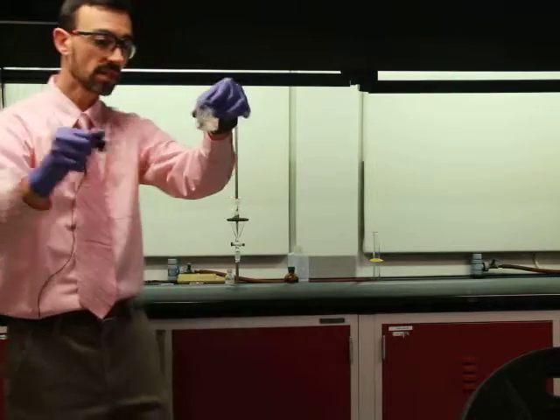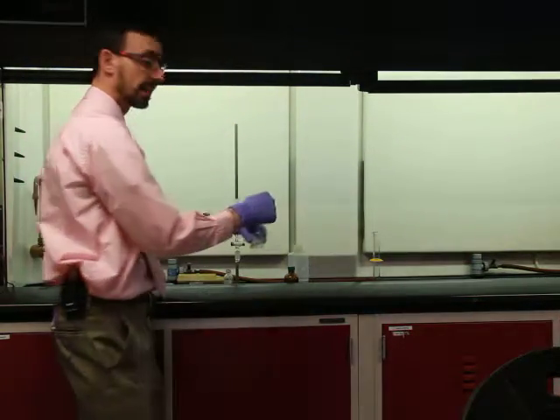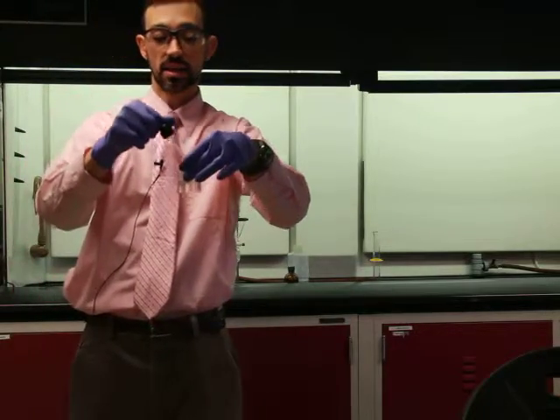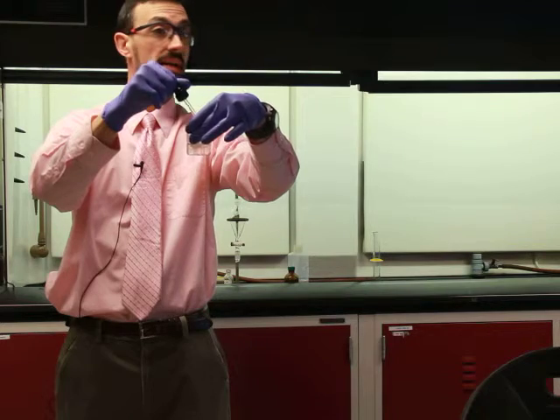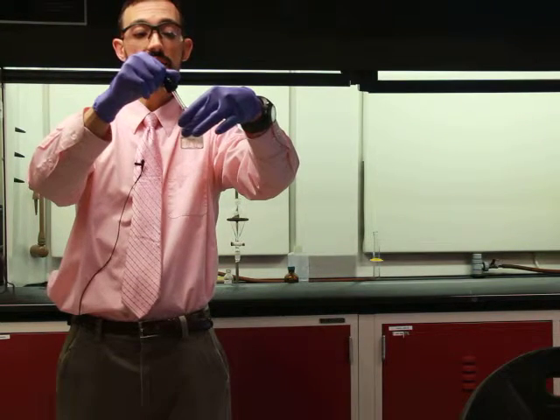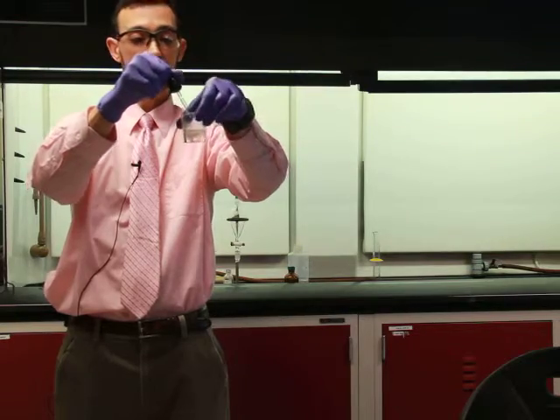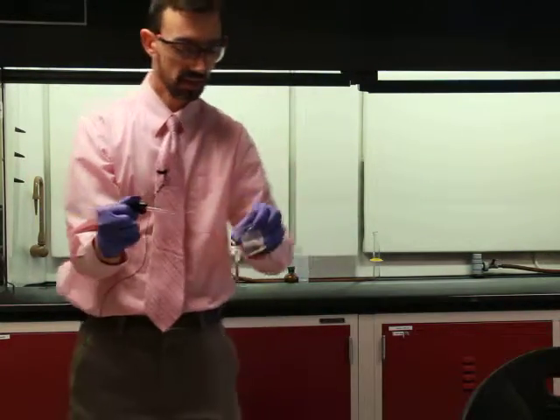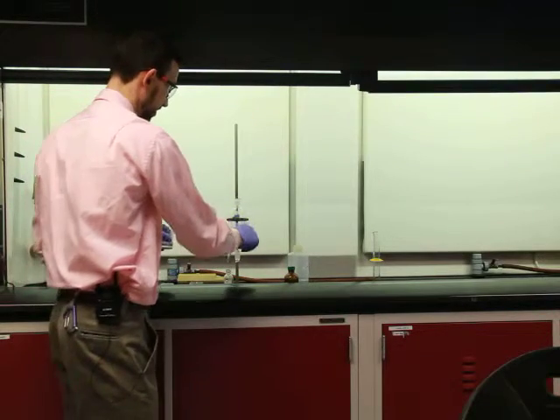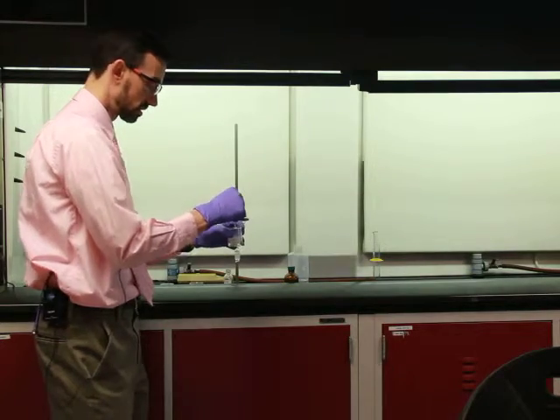Okay. Making this cold would also help out. That would crystallize it and lower the solubility, because we know temperature dependence plays a role here. So if I chilled this, I would actually get even more of the acid molecules to come out. So it's getting pretty close now. You see how long the cloud hangs around? Actually, it's all forming on the top now that I look at it.